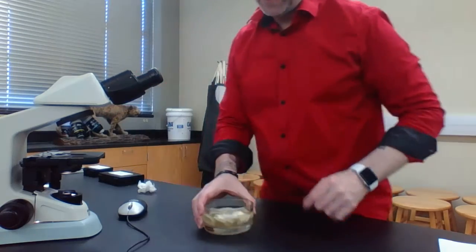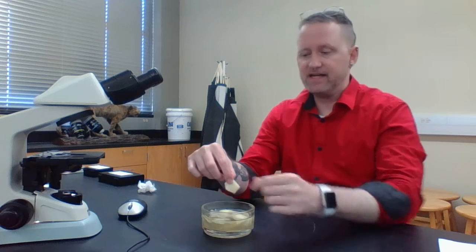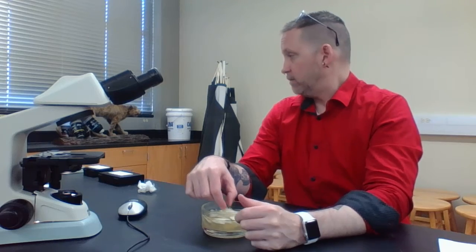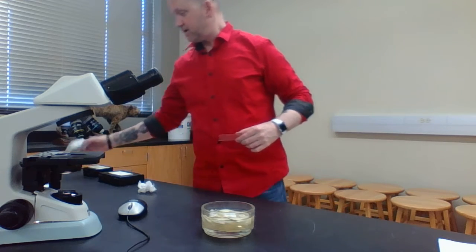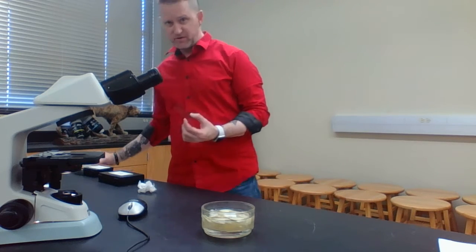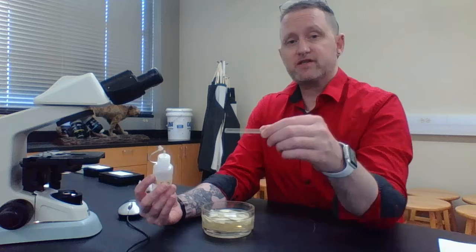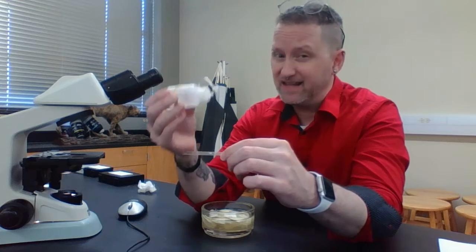What I've done is grabbed either a yellow onion, a white onion, or a purple onion, which sometimes they call red onion. I cut the leaves around the bulb, and usually you let them soak for a couple of hours. You're going to grab a clean microscope slide. Sometimes they're in nice little boxes, but if we have some microscope slides that students have already used, we can use those, because we use these clean microscope slides over and over again. I'm going to take this clean microscope slide and put just a little drop of water. Not a lot.